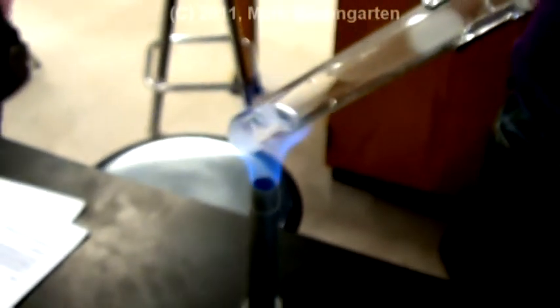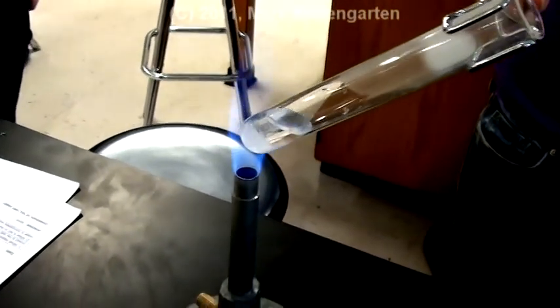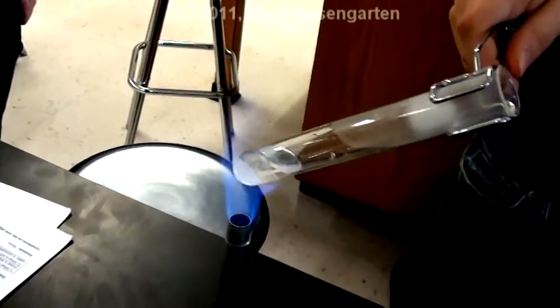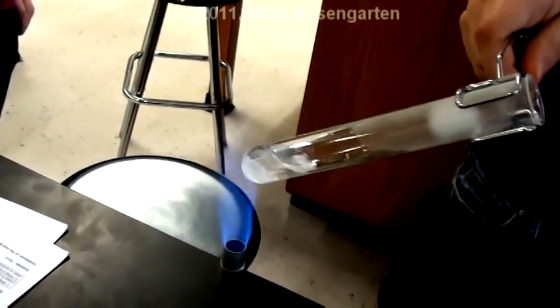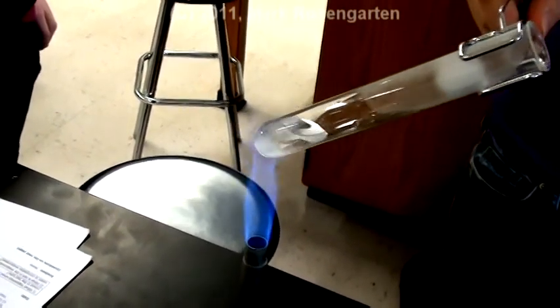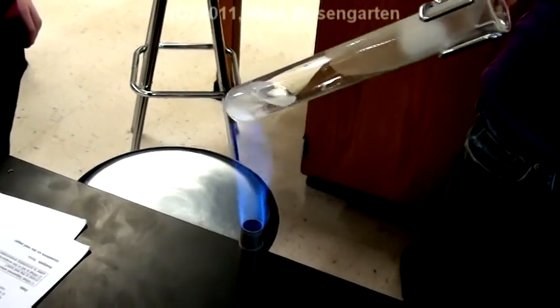When one of you is heating that up, the other one of you will be measuring out the next chemical — keep track of where you are in your procedure. Next, heat the chemical in the test tube a little higher in the Bunsen burner flame. You may feel the chemical kick as it breaks up into the water.